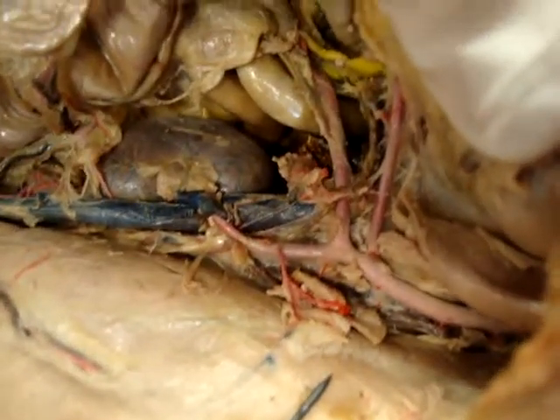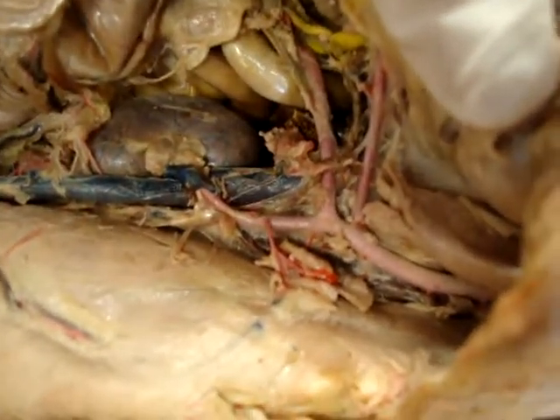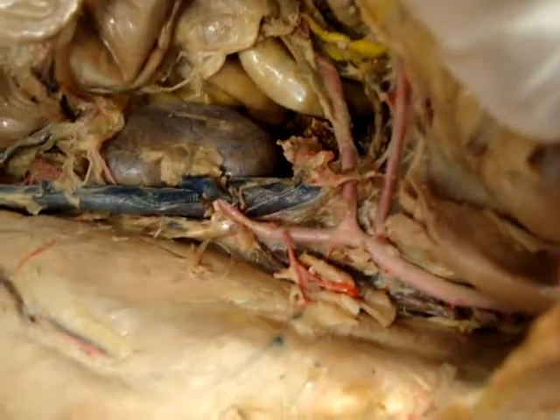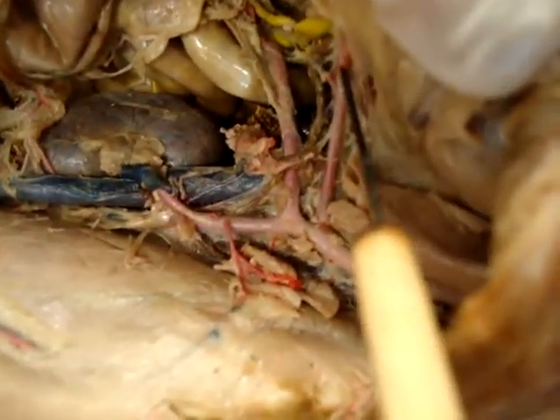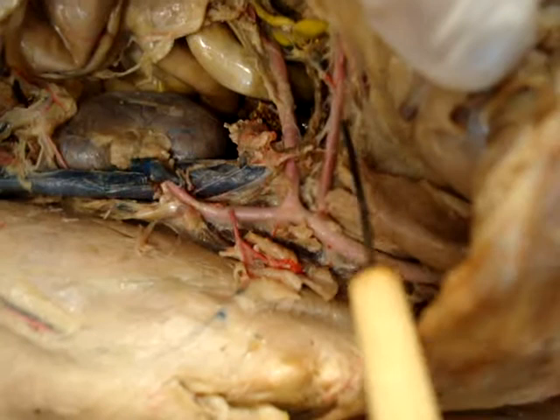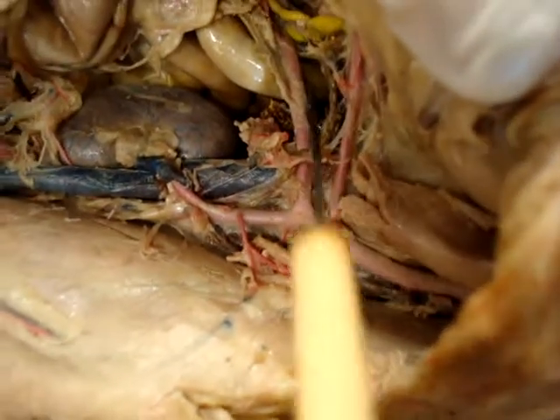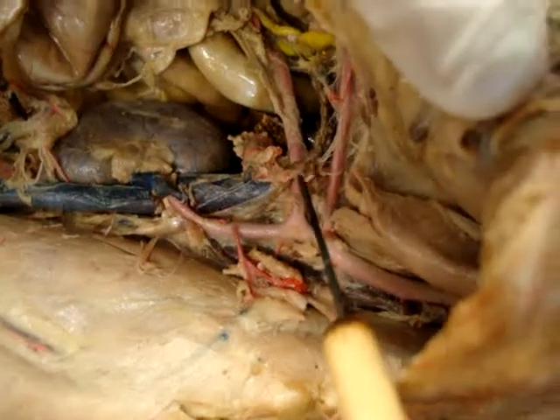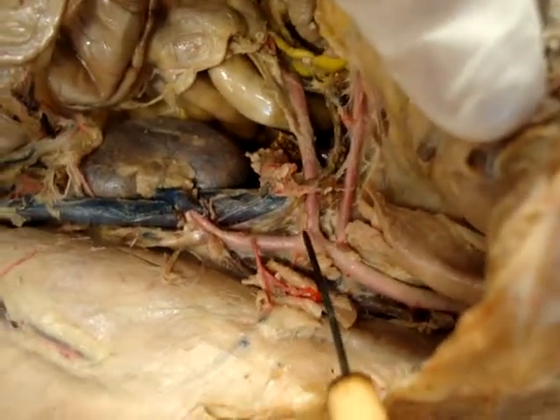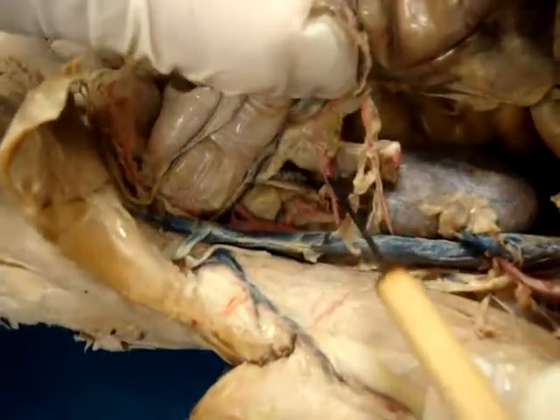We're doing the second video of the cats that Professor Rose has chosen, and we're going to start with the celiac artery, which is right there, and then the superior mesenteric artery, then the inferior mesenteric artery, which comes off the aorta below.